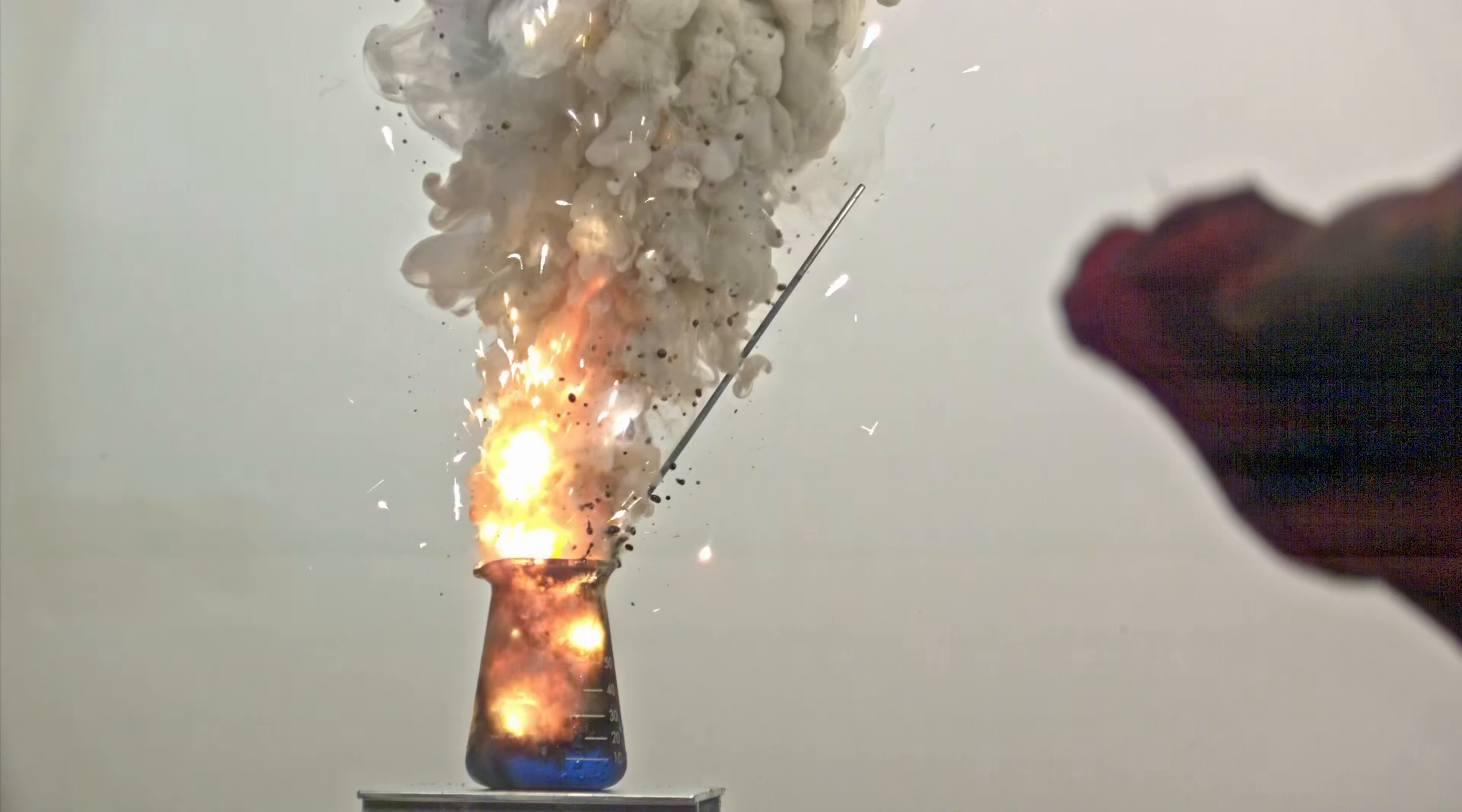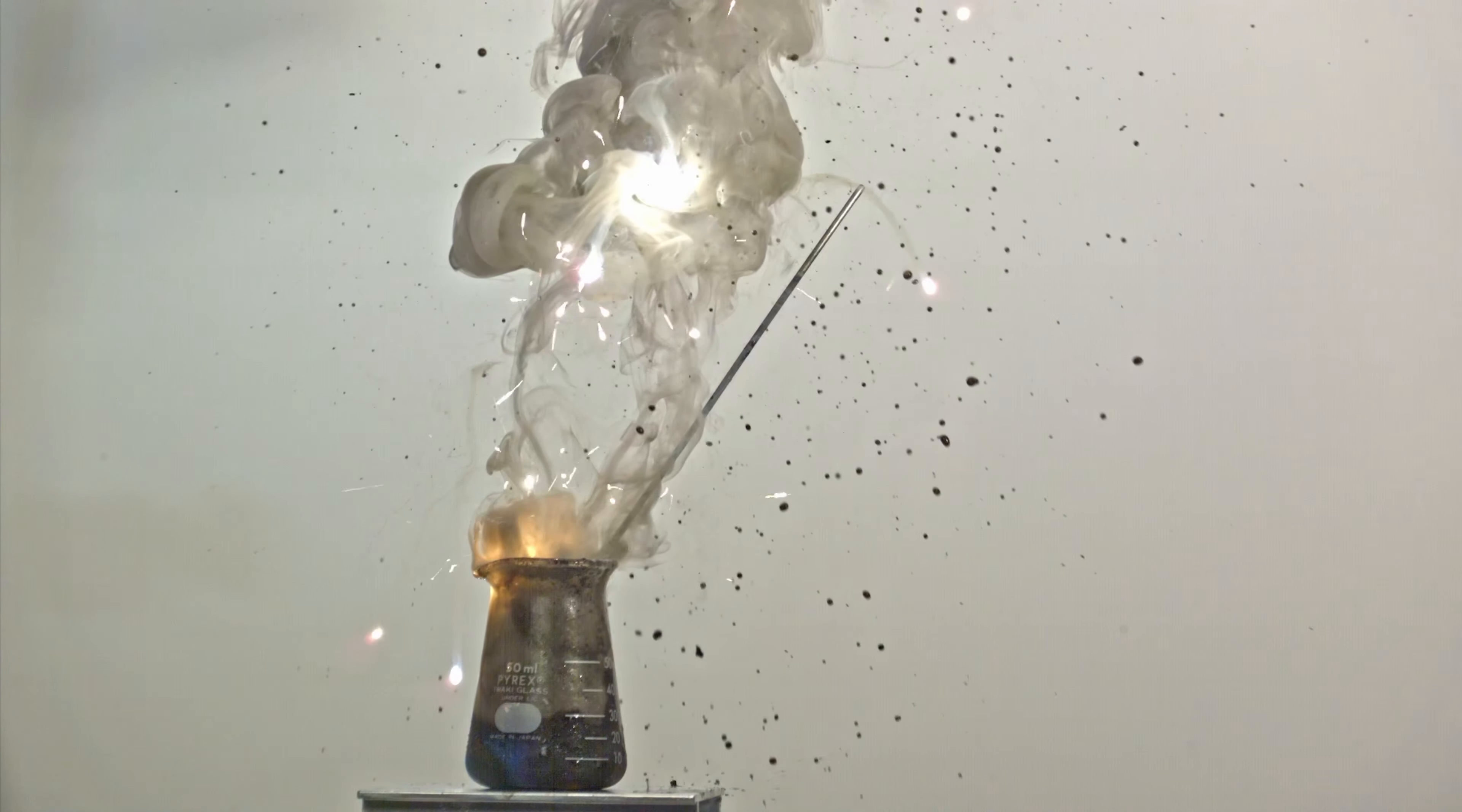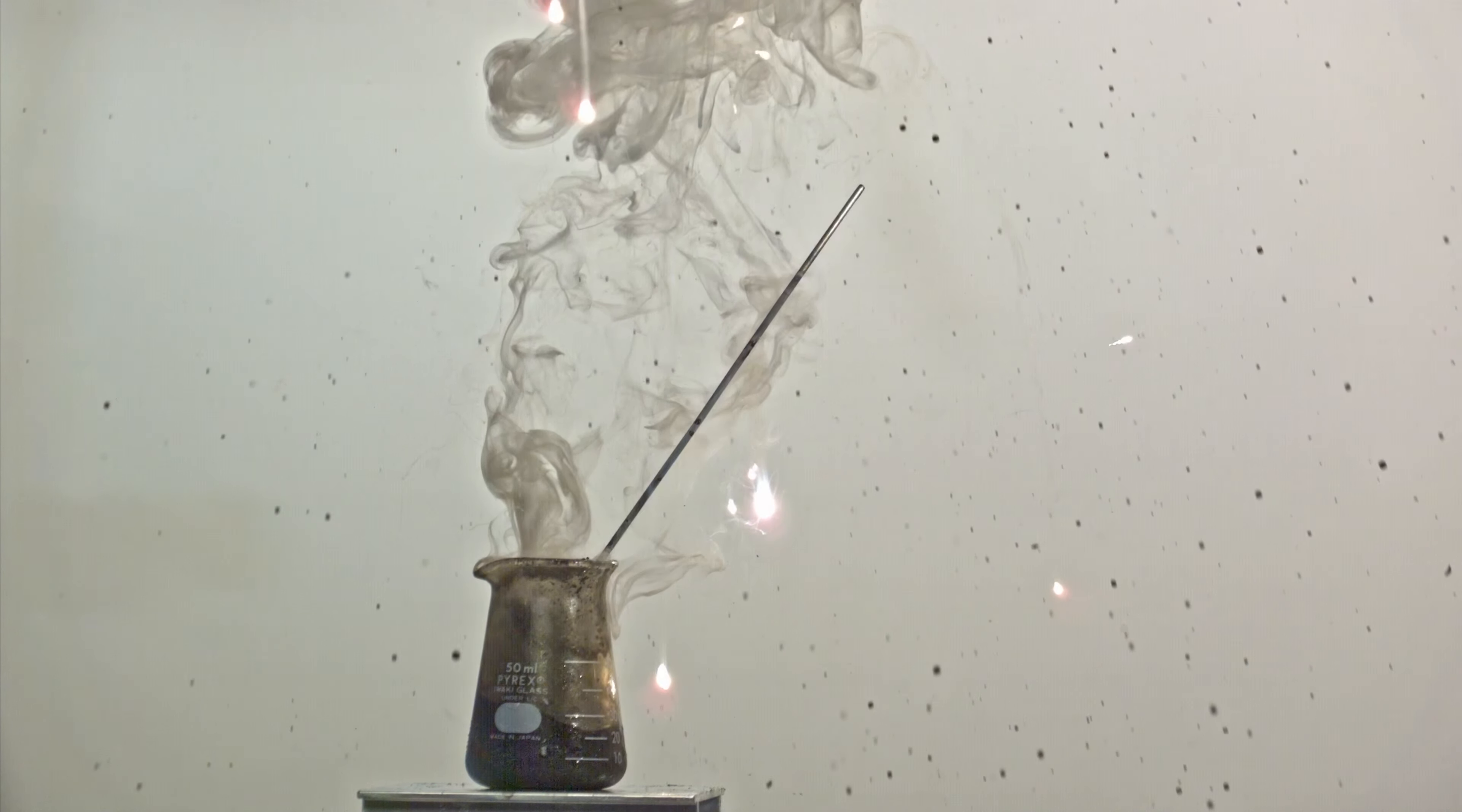I used the same high-speed camera settings for all reactions, and with this one, the flash was absolutely blinding. This clearly shows the difference between a regular tetrachloromethane reaction and one with ozonated tetrachloromethane.